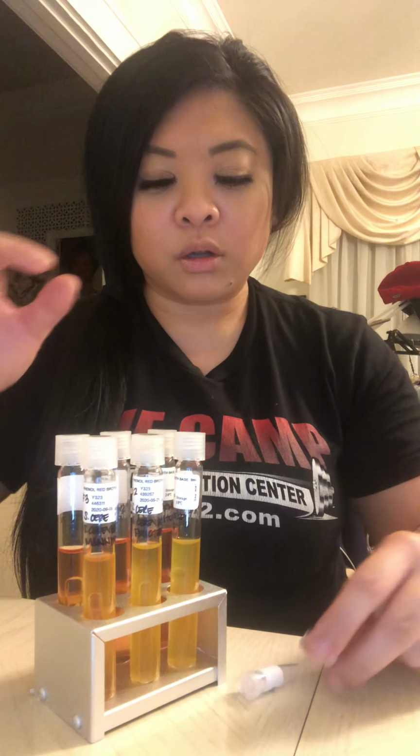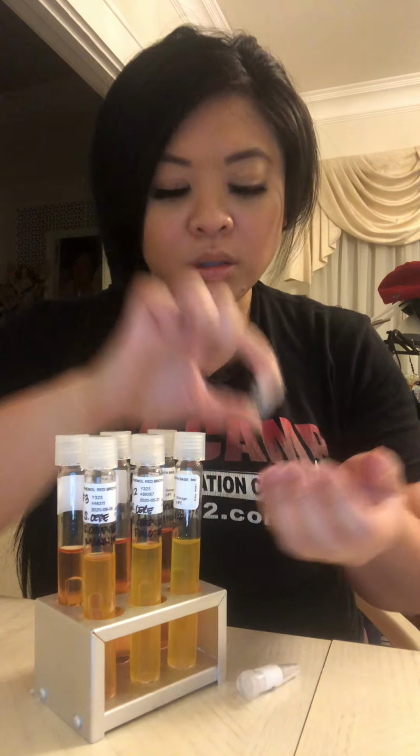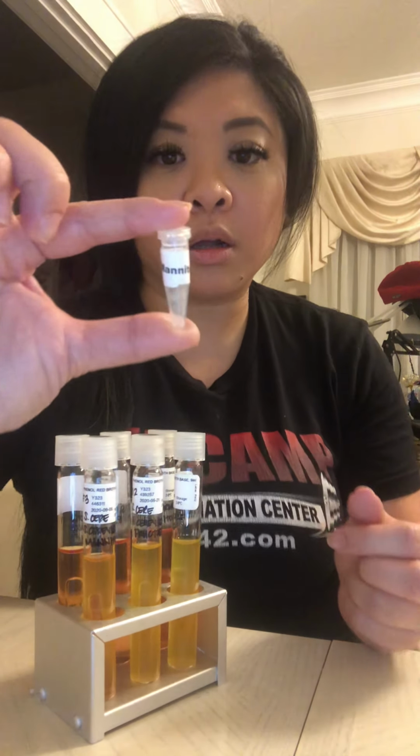The fermentation is what actually happens to carbohydrates when they no longer have oxygen. So this is something that is anaerobic. The carbohydrate testing, we use 3 different powders, which is glucose, fructose, and mannitol.